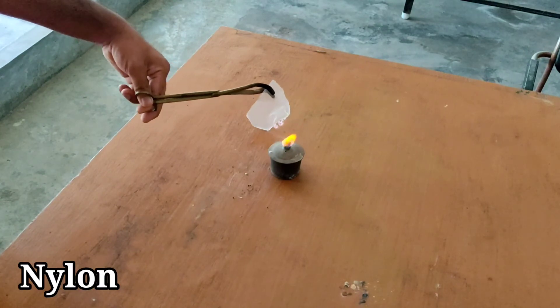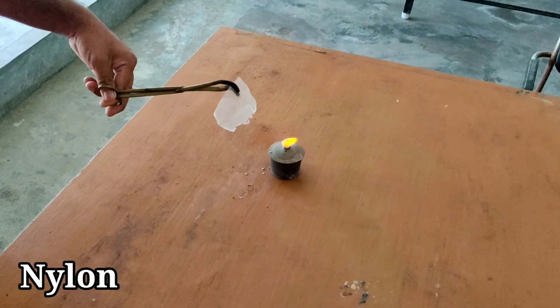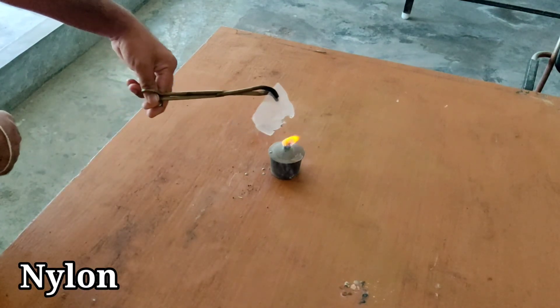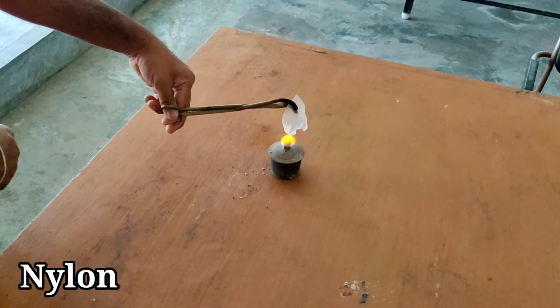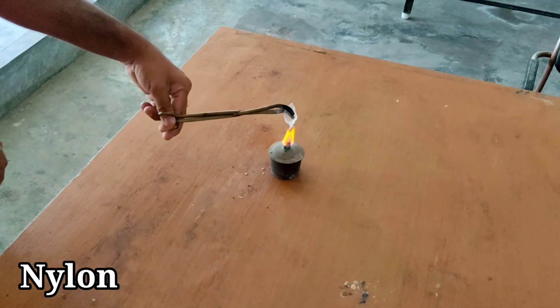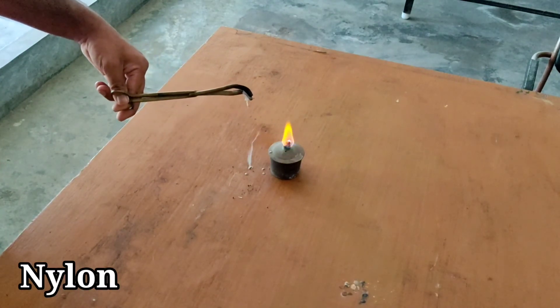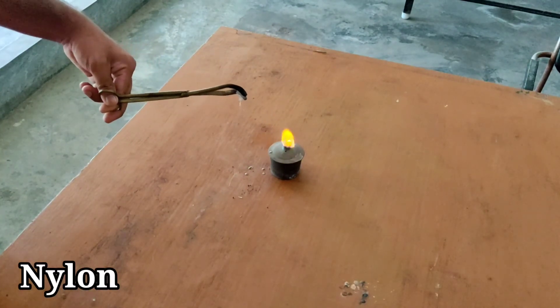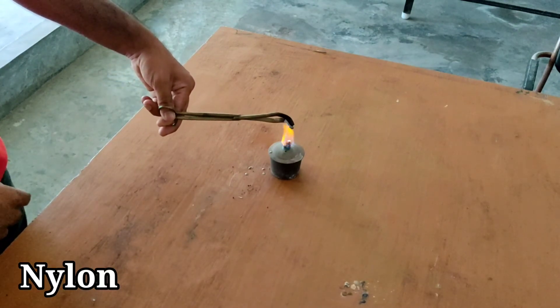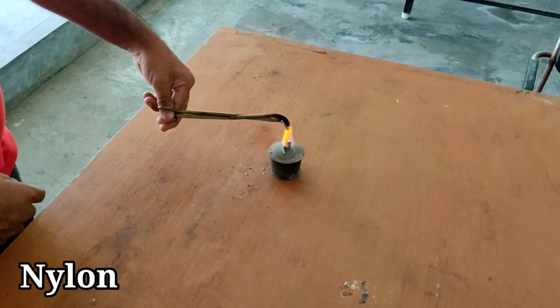The nylon fabric self-extinguishes — it stops burning when removed from the flame — and then eventually burns continuously and melts. The residue is a hard cream or black bead.